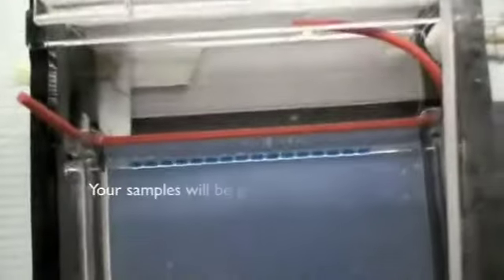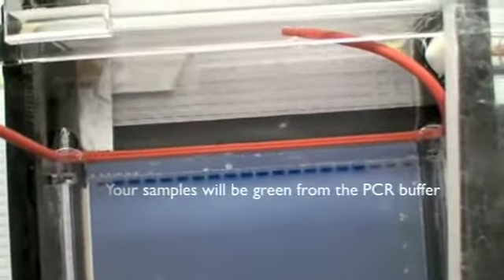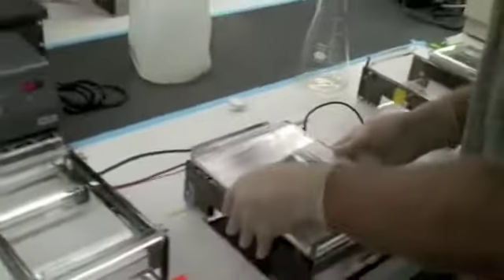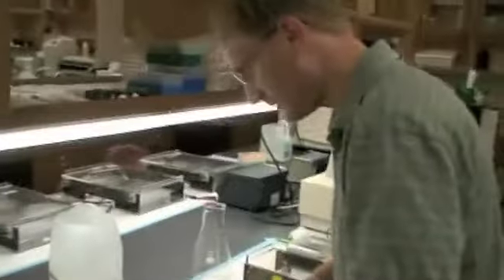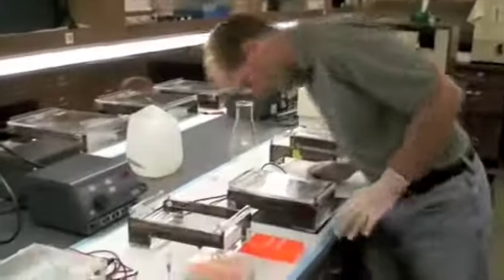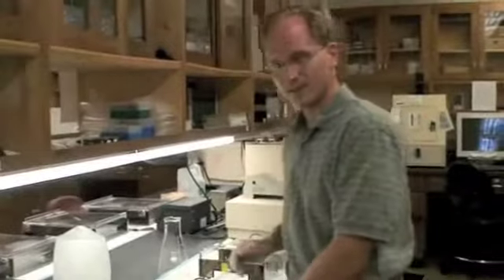Now if you come in with the camera there and put it straight up, I don't know, to me, it looks like there's a little more blue on the bottom of the wells than there is at the top. And so I think that I'm 100% confident that it's running the right direction. We're good to go to wait for 40 minutes and come back.